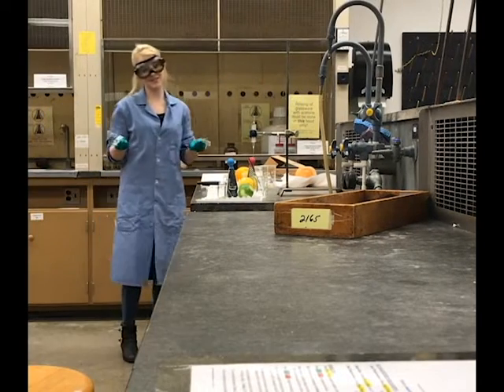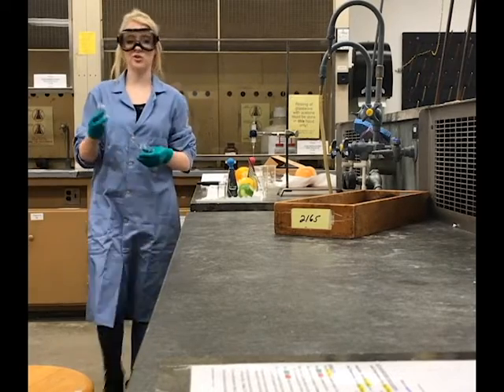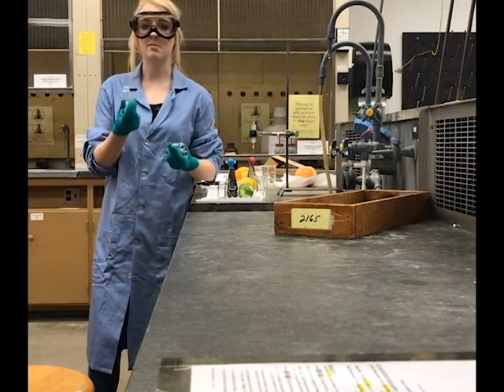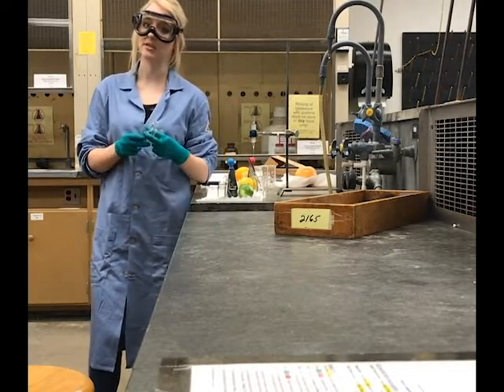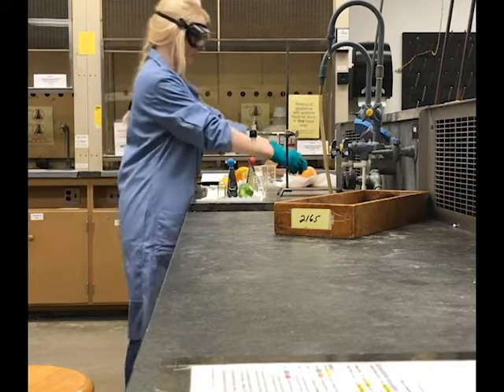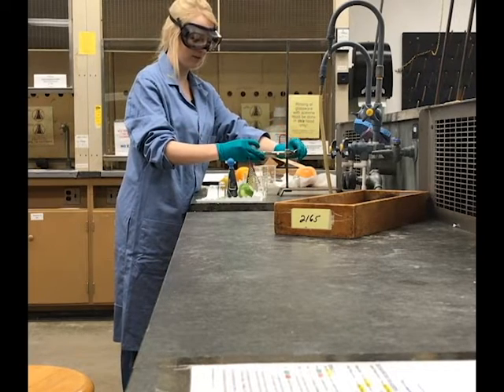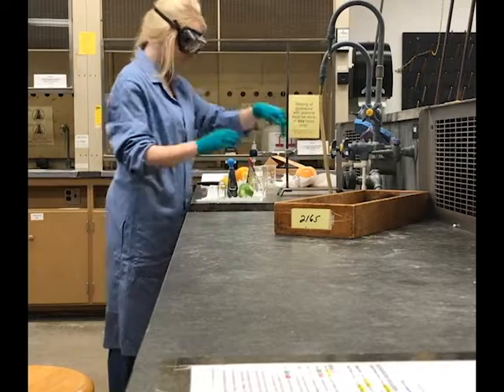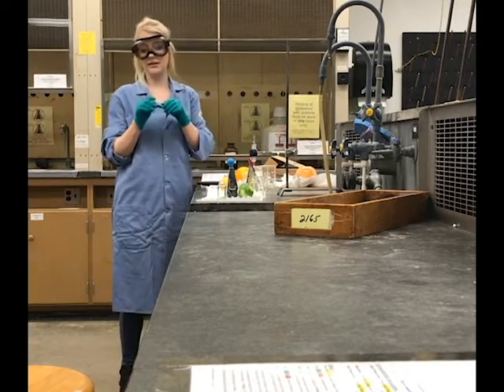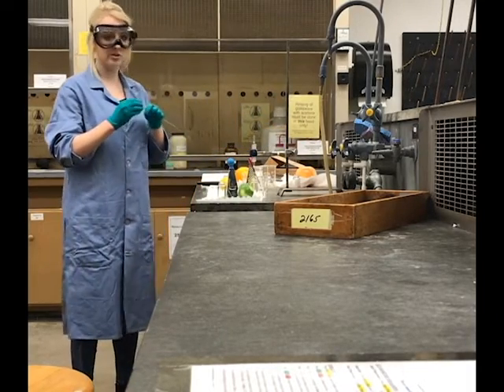But of course, in order to filter anything, we need to have a separate container. So we will just use separate vials for now, and then we will pipette the methanolic solution into our gas chromatography vials. So now it is important to properly position our filtration apparatus directly over the vial. I have already grabbed 4 different clean Pasteur pipettes. So first, we will start with the grapefruit.